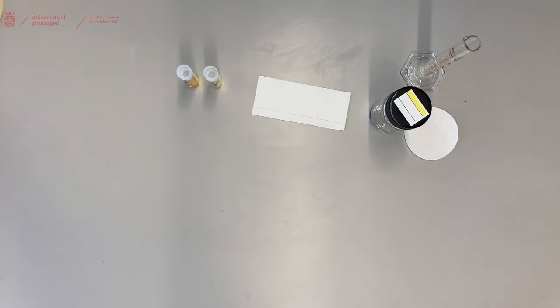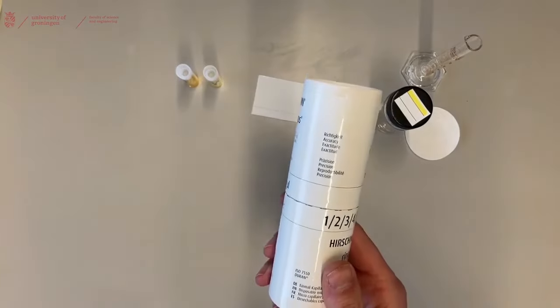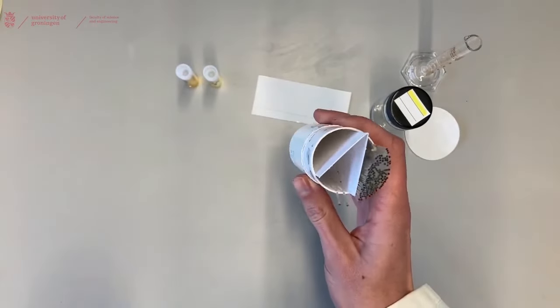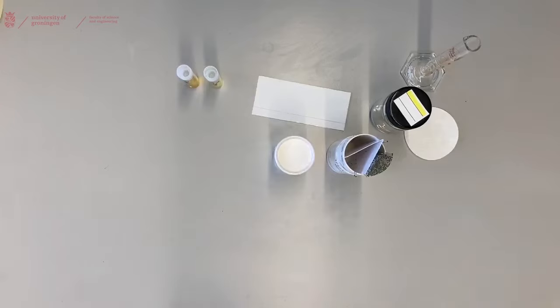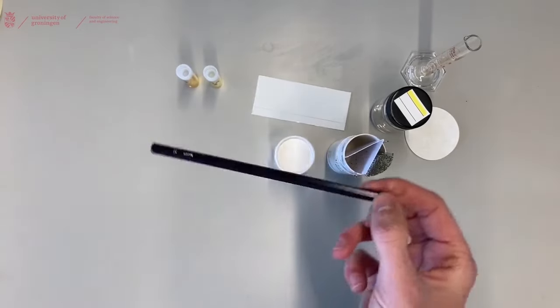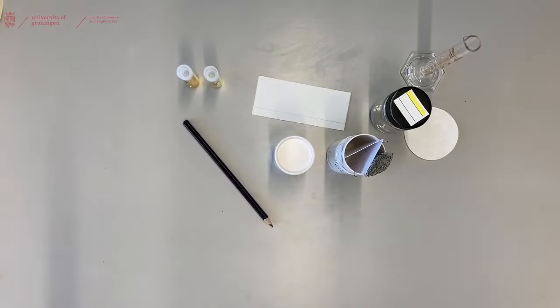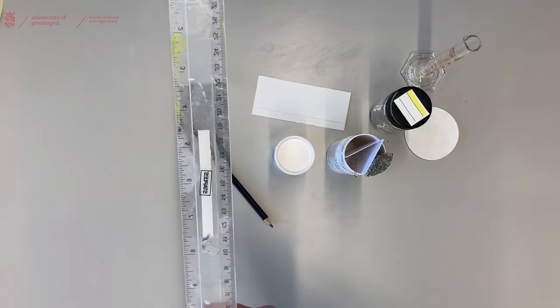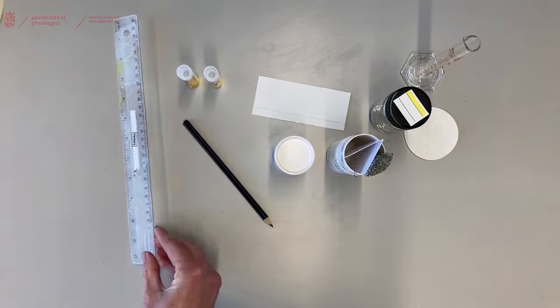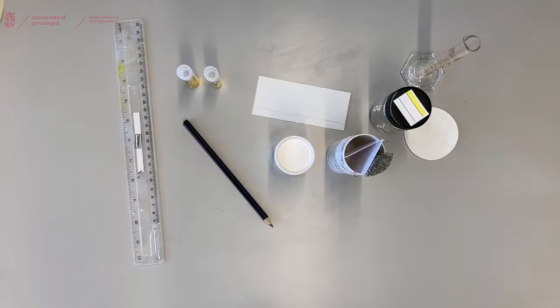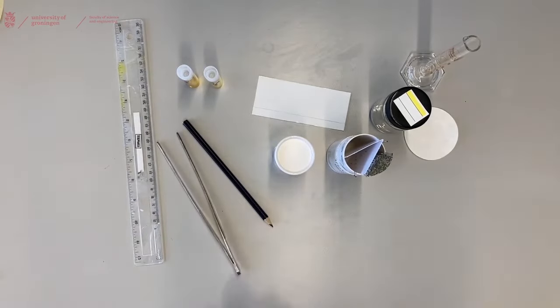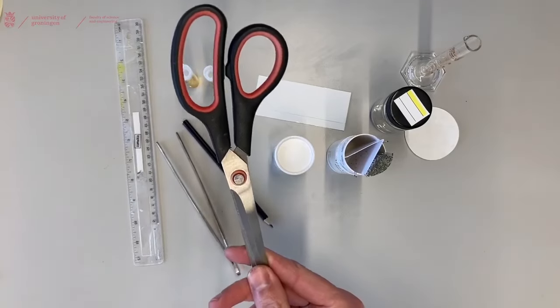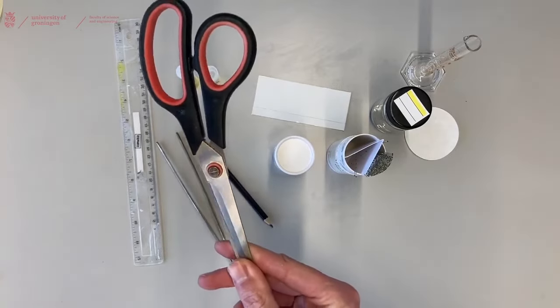You'll need capillaries, a pencil, a ruler which is useful, and tweezers.